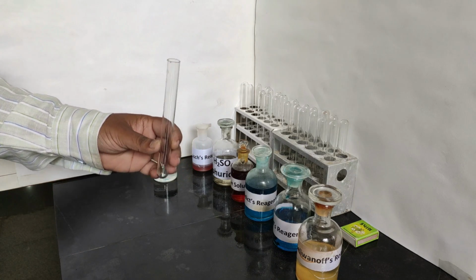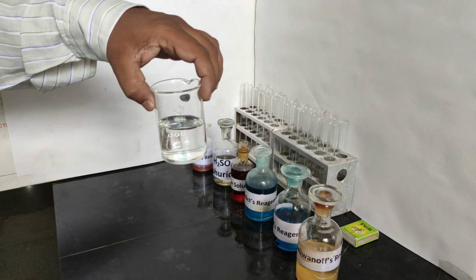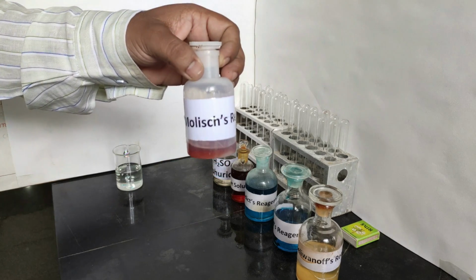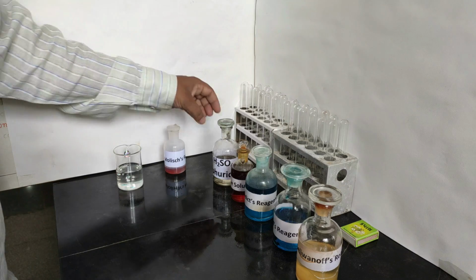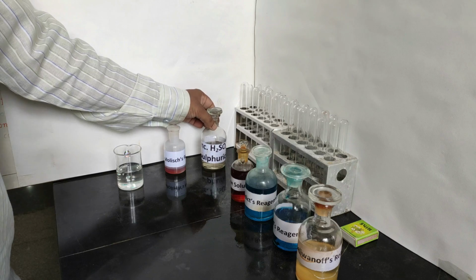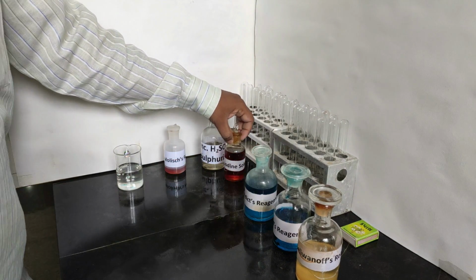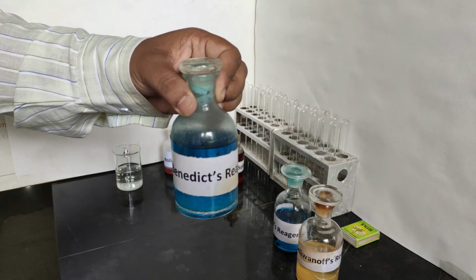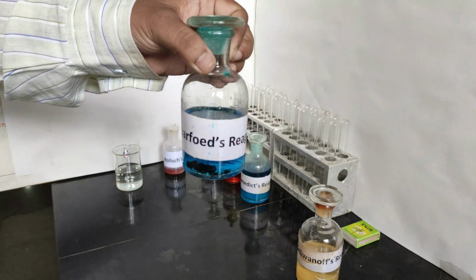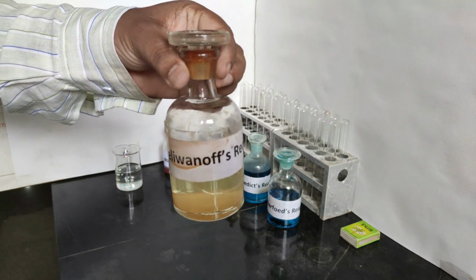We will require test tubes, sample solution, Molisch reagent, concentrated H2SO4, iodine solution, Benedict's reagent, Barfoed's reagent, and Seliwanoff reagent.